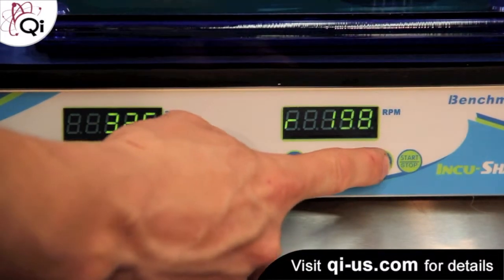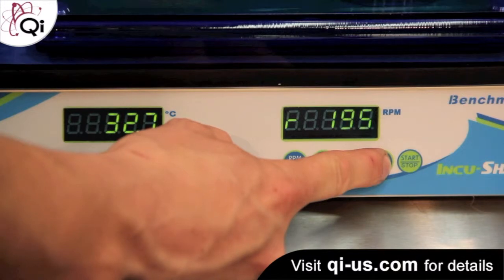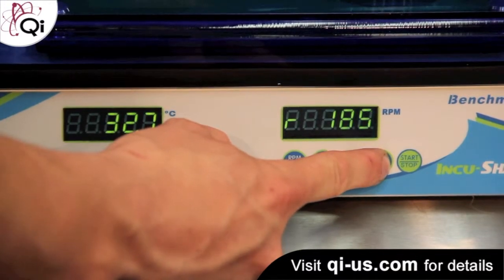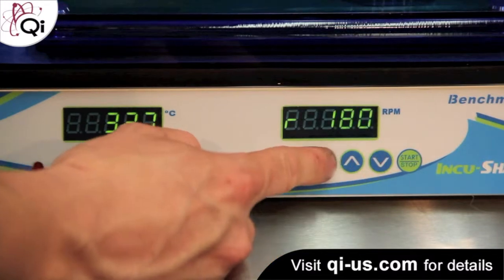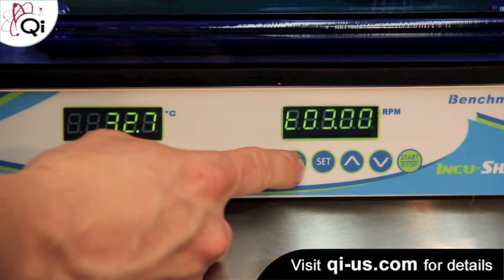Once you have set the temperature, you can quickly set the rotational speed in RPMs and you can also adjust the run time for the incubation period.